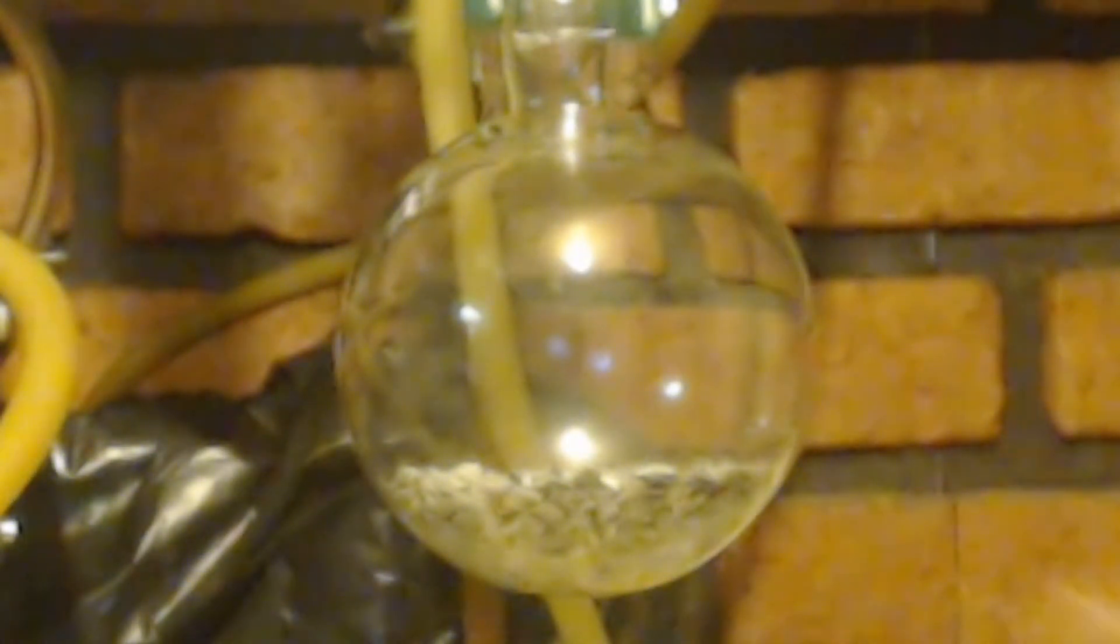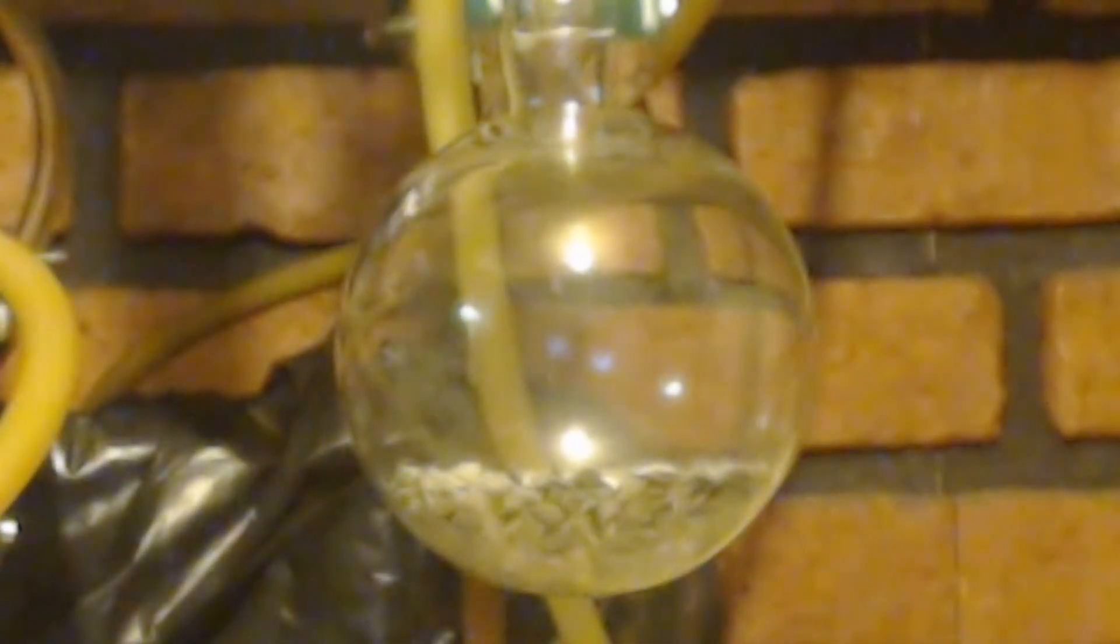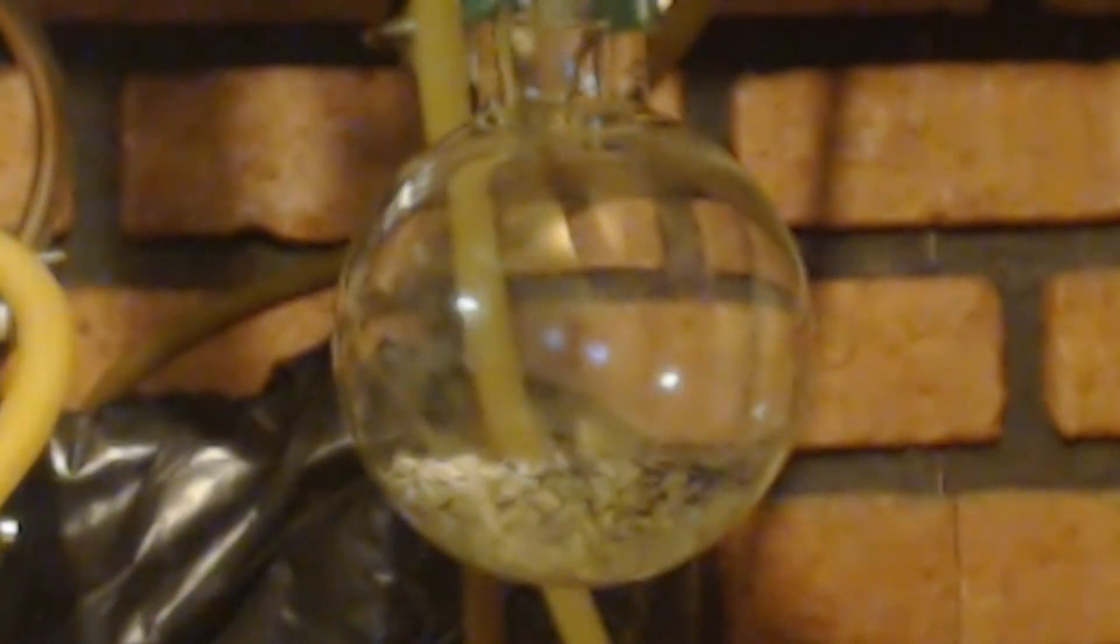I can barely touch this. This water I can put my hand in. No big deal. Yeah it's definitely working. So I'm going to start dripping it slowly in. Just to keep the reaction going. Keep it refluxing.